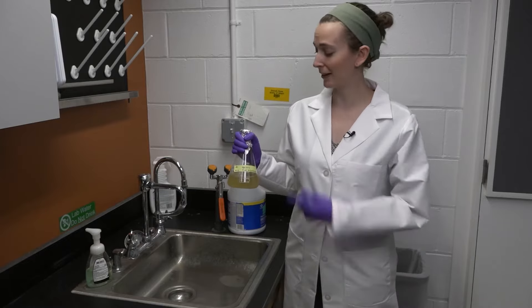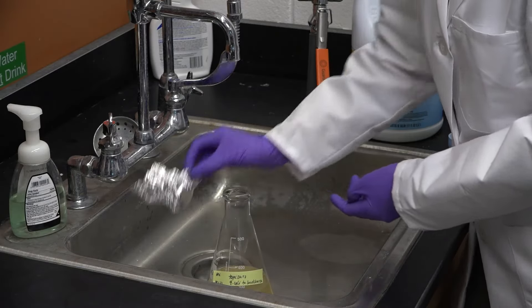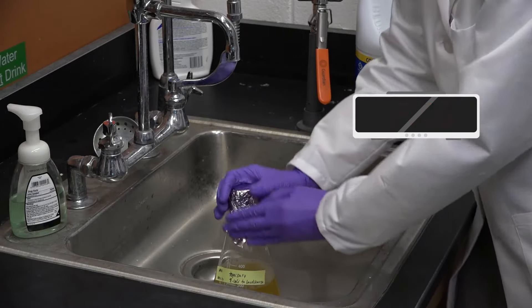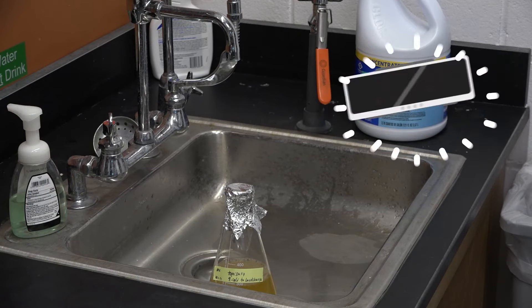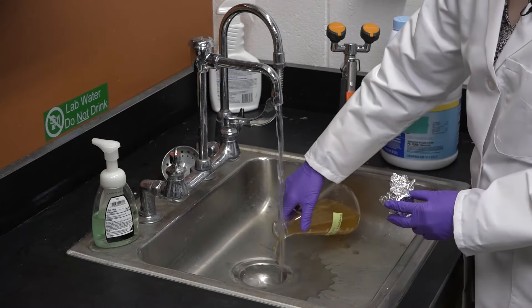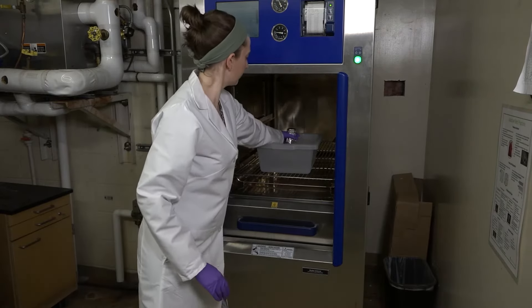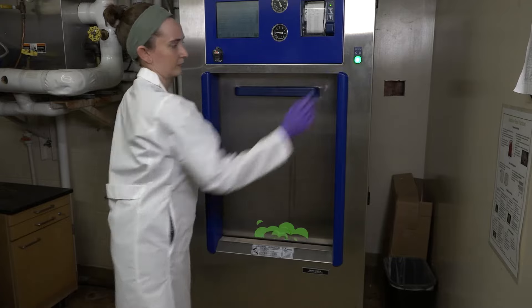Liquid biological waste, like these bacterial cultures, needs to be treated with a chemical disinfectant before washing it down the sink. We add bleach to our liquid biowaste to reach a final concentration of 10% bleach. I have a 250ml bacterial culture here, so I need to add around 30ml of bleach to reach 10%. The biowaste has to sit with the disinfectant for at least 20 minutes before rinsing it down the drain with plenty of water. You can also autoclave liquid biowaste prior to drain disposal, but do not add chemical disinfectant if you plan to autoclave — bleach plus autoclaves equals very, very bad.